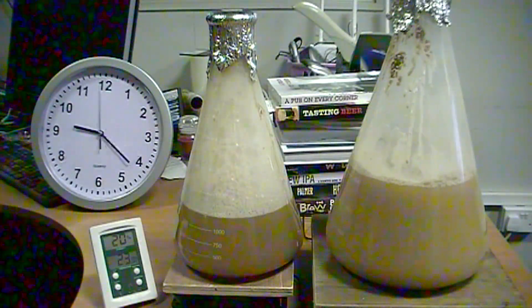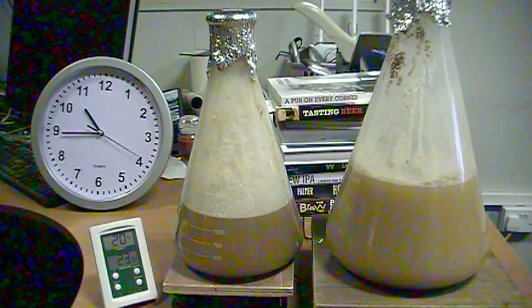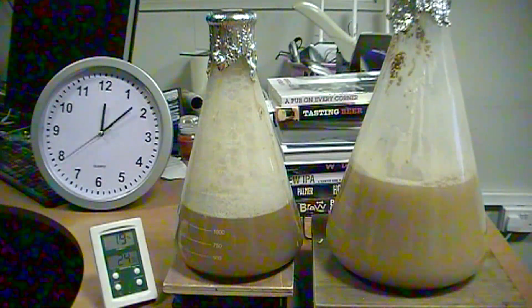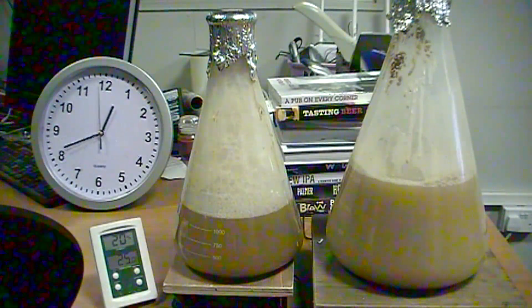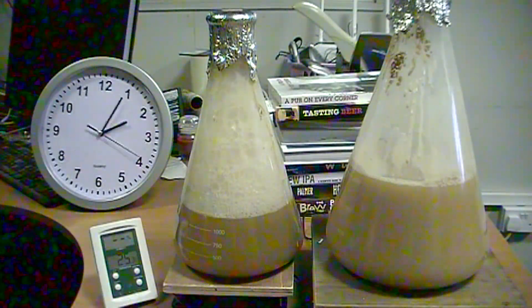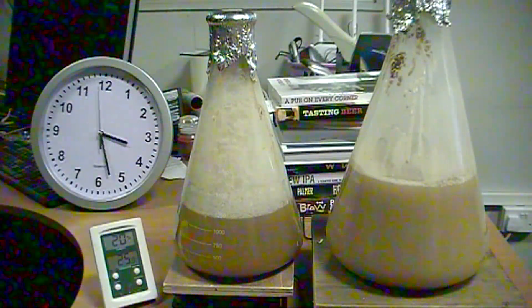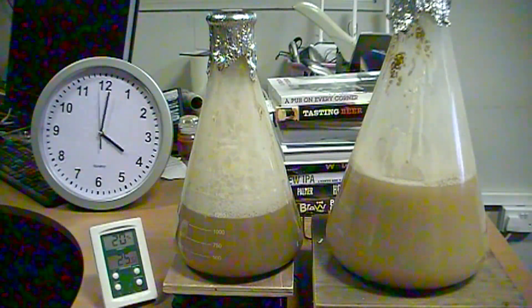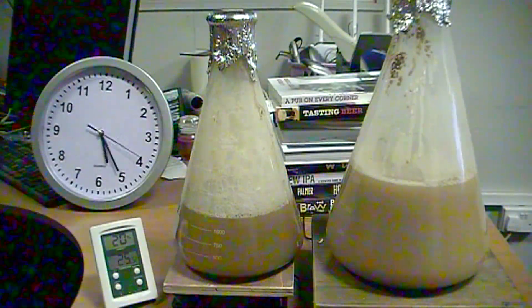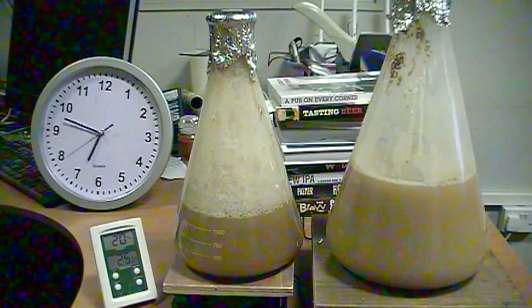The one on the right — where it overflowed at the top of the flask — is now dried out. If this was in a sterile environment you could actually harvest that as dried yeast, but it's not a sterile environment, it's a manky old office. The one on the left is about to erupt — as that temperature creeps up it's far too high. It would be much nicer to have a steady, stable environment.